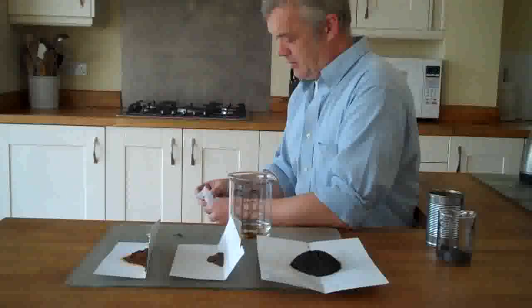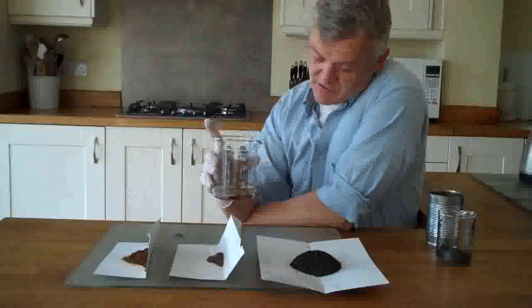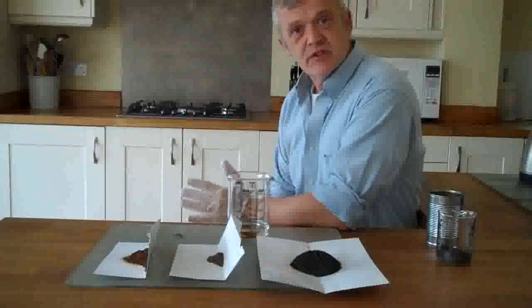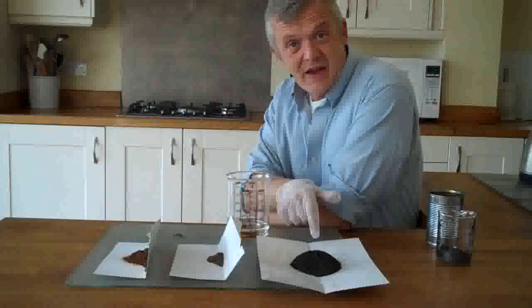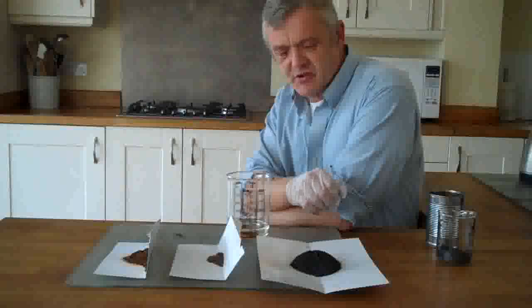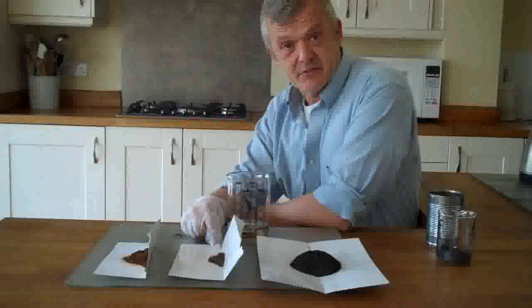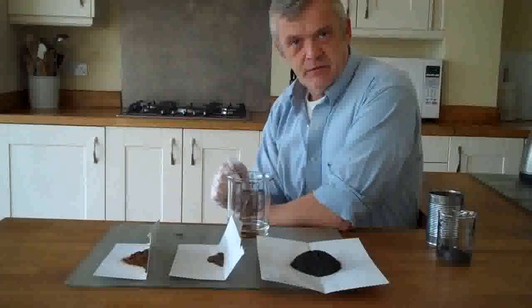In order to make this stuff, we have four components. We have 75% sulfuric acid — I used 96% sulfuric acid and watered it down with deionized water to get to 75%, obviously adding the acid to the water — so there's 100 millilitres of it. Here we have 20 grams of 325 mesh natural flake graphite — it's a good size, big enough to do something with and small enough to intercalate easily. We also have 7.2 grams of potassium permanganate and 3.4 grams of iron chloride, and we're going to add those to the sulfuric acid.